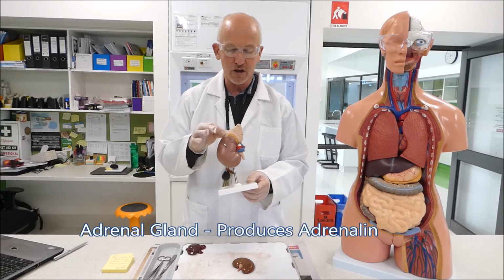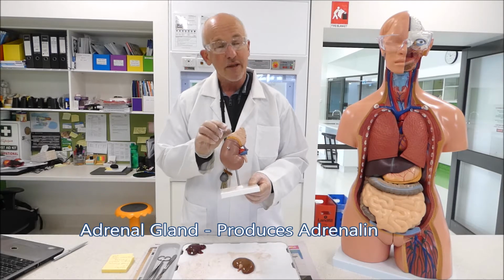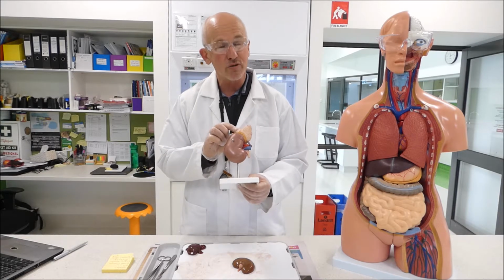This structure on the top of the kidney is the adrenal gland. On the kidney we're going to dissect today, you won't see the adrenal gland because it's usually taken off. But that produces adrenaline, which can increase our heart rate and can change our blood pressure. It's usually what they call a danger response hormone.